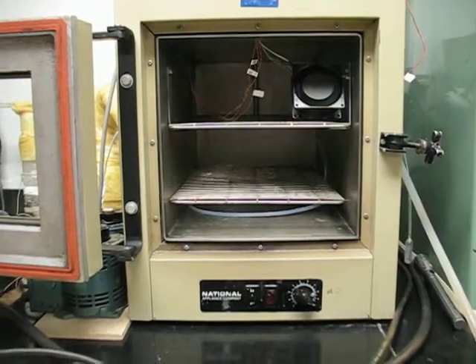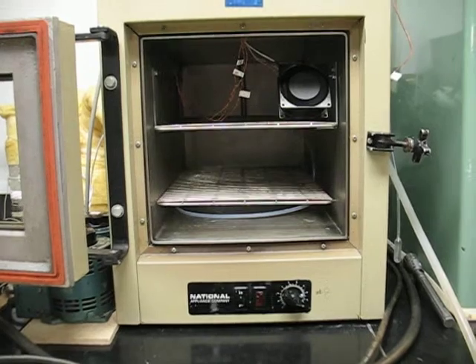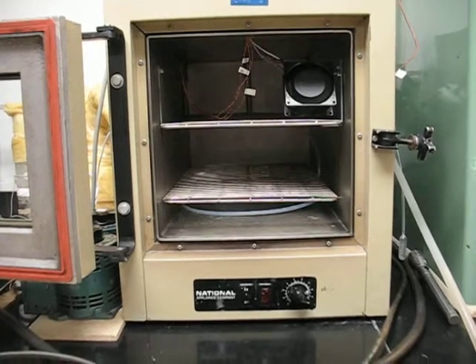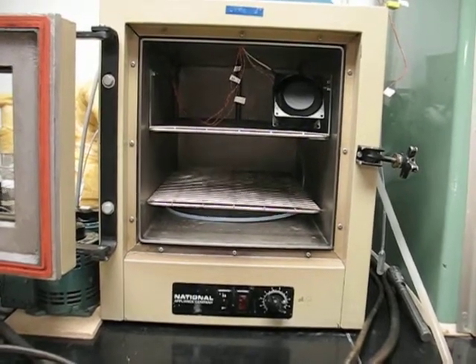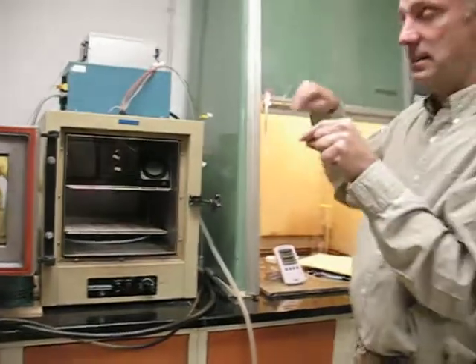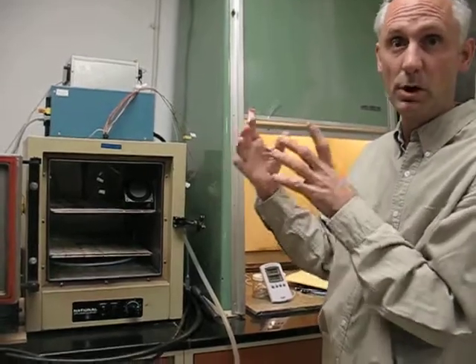And the jars are going to be opened? And all the jars will be opened. We've designed an arrangement of the samples where we have the 4 different types: the untreated sand, the treated sand, an empty bottle, and an empty bottle with the treatment in it. And those are going to be staggered and alternated throughout the oven. So if there is any variability across the oven, we hope to see that.